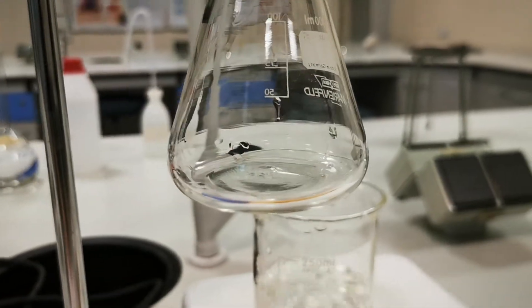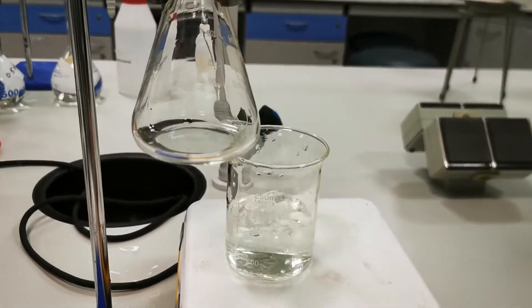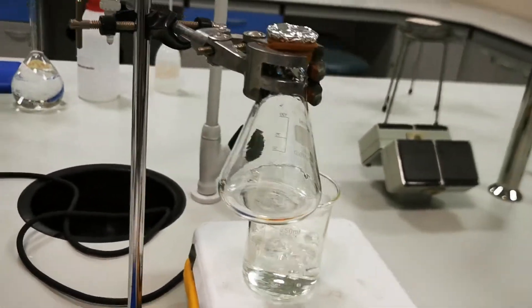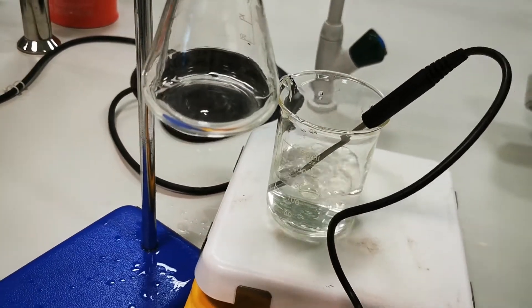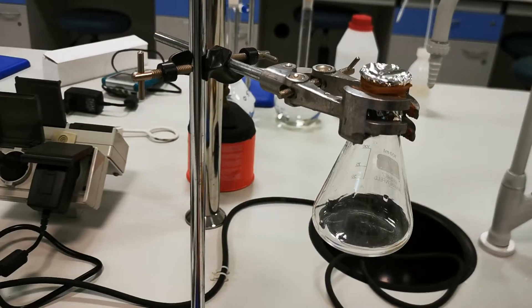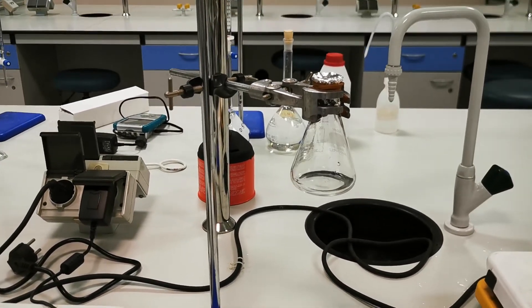There is nothing remaining in the Erlenmeyer flask. So, I'm going to stop heating the water, and I will measure the temperature of the water, and I will let this flask cool, so I can measure the mass again.